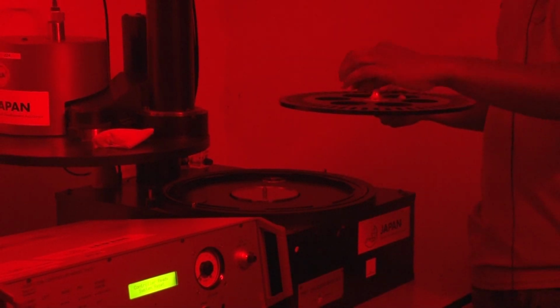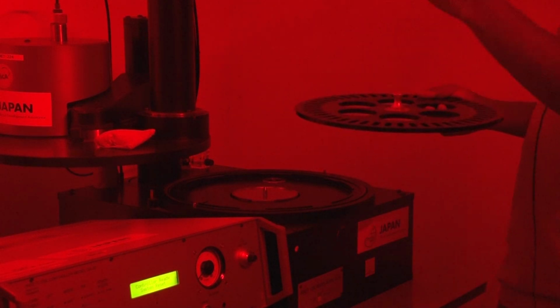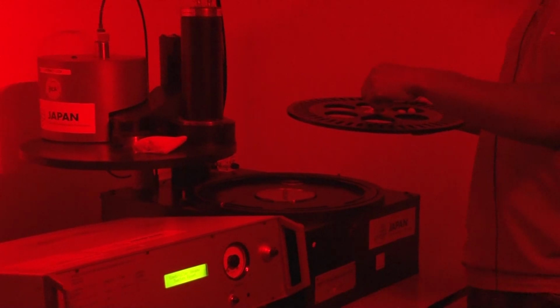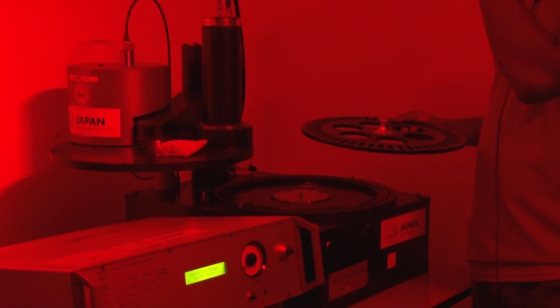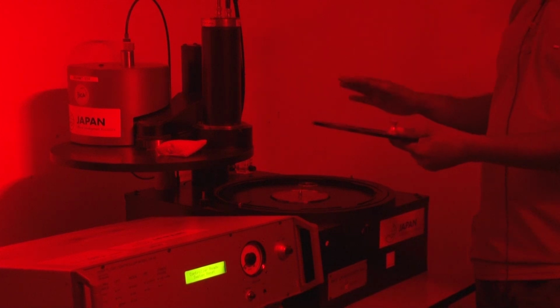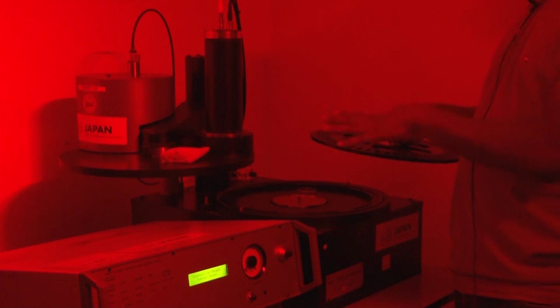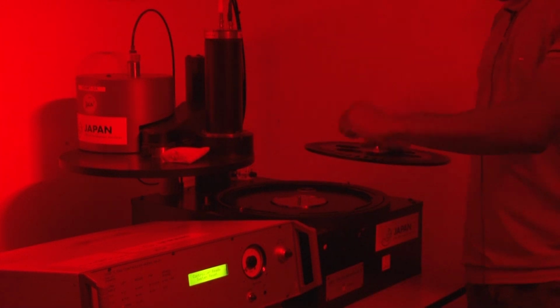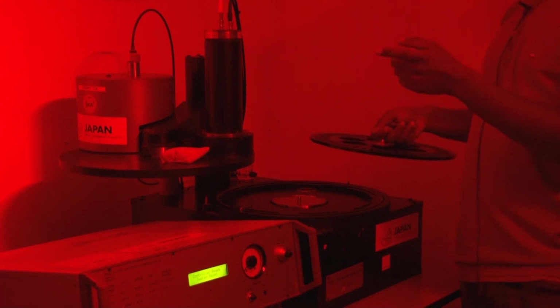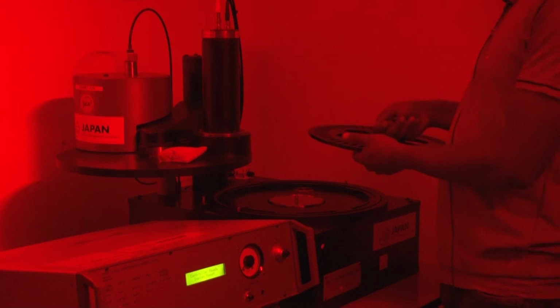Each and every disc is treated based on your protocol. I will come to the protocol part. The protocol is for the measurement of OSL for medium-size sand or quartz grains. You assign that protocol through your sequence editor, which is the software part. I will come to that later.